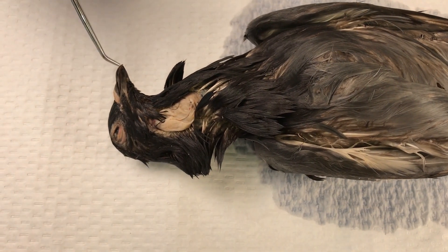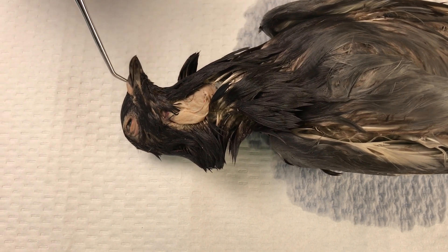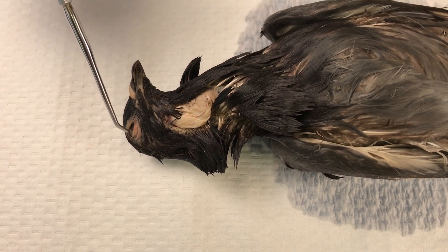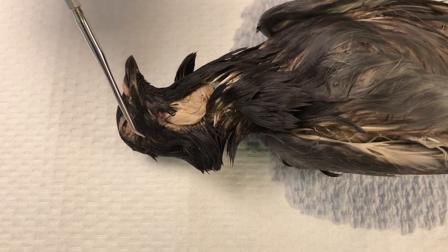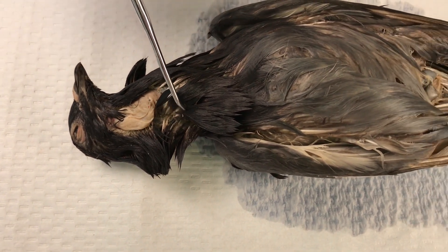Here we have the bill or beak, behind which is the cere. There's the eye, and to see the ear you might need to remove some of the feathers. Those feathers are distinct to birds.